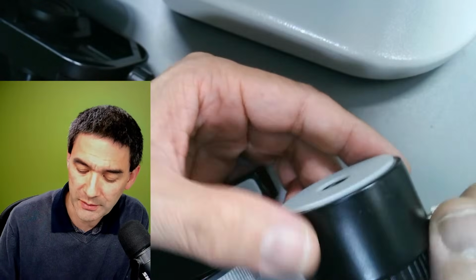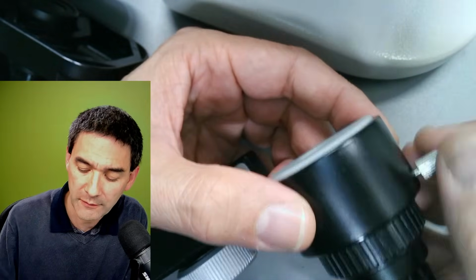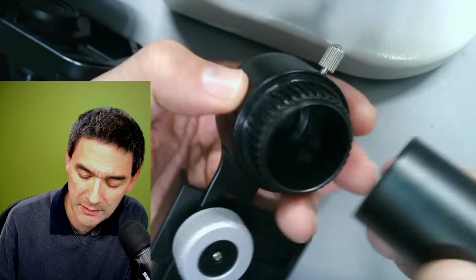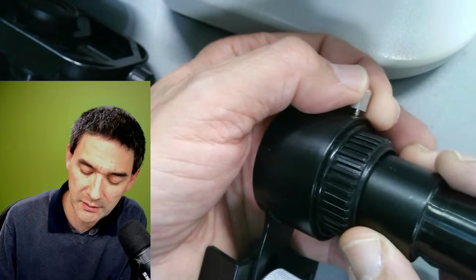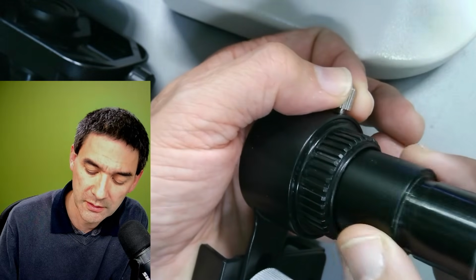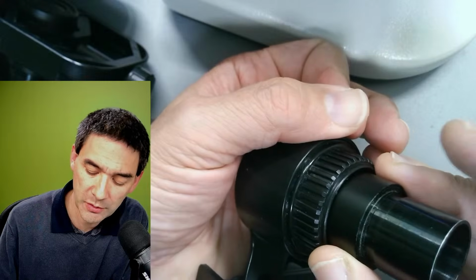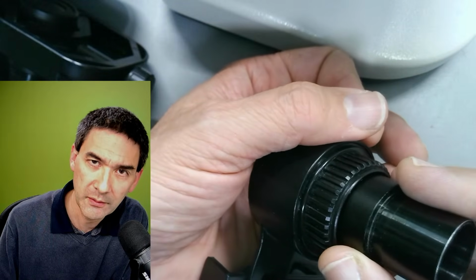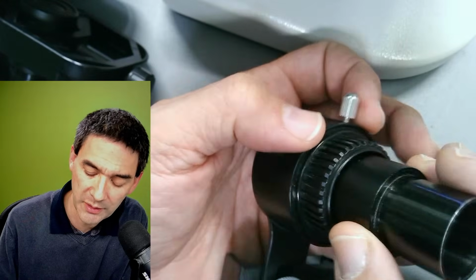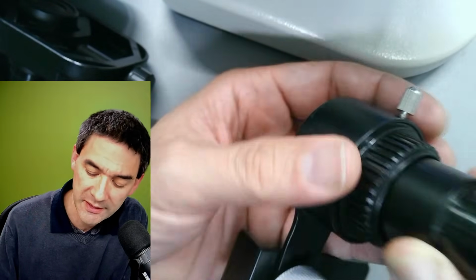However, with those systems you have to adjust the distance away from the eyepiece, and this means that you sometimes have to take it out a little bit and then turn it. Unfortunately, if it's too far out, it's not going to hold, right? So always be aware that when you connect the camera to the eyepiece, on one hand, the distance has to be correct. On the other hand, it's got to be sufficiently tight.